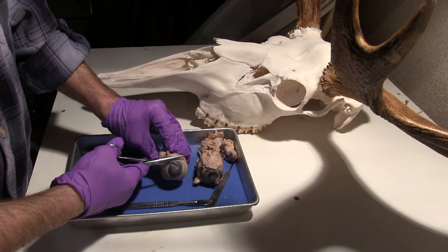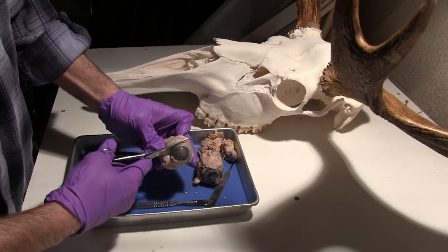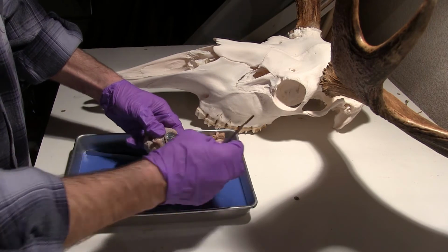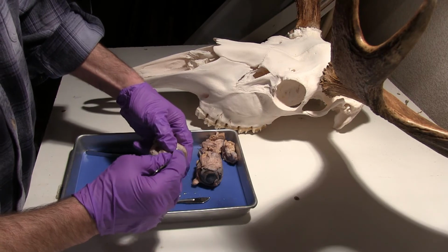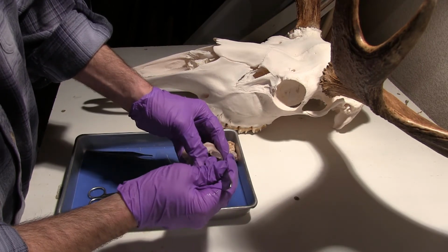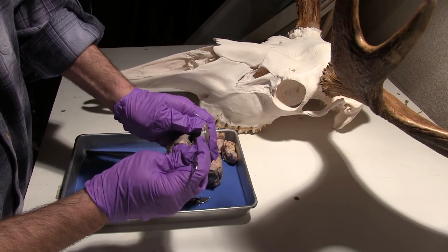And you can really tell how tough the cornea is when I cut through that area. I'm cutting through the cornea and then the sclera right back up on top of that. And if I just open this up at this point, right here I can actually see that anterior portion. What we can see behind this, the lens is right there, and you can see I actually cut in through the posterior portion as well.